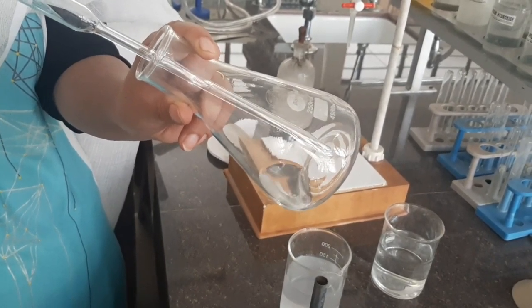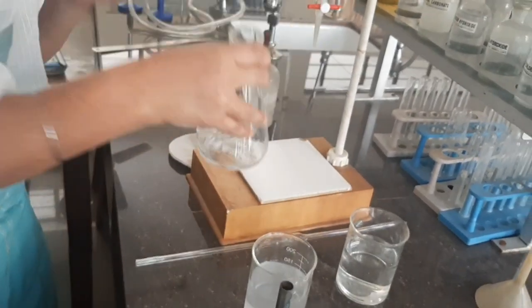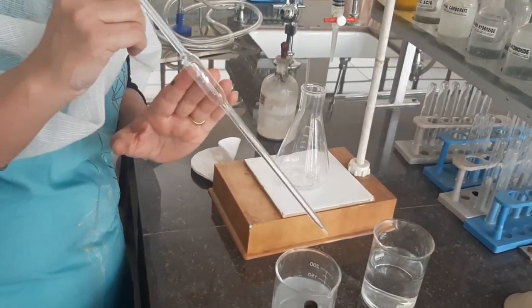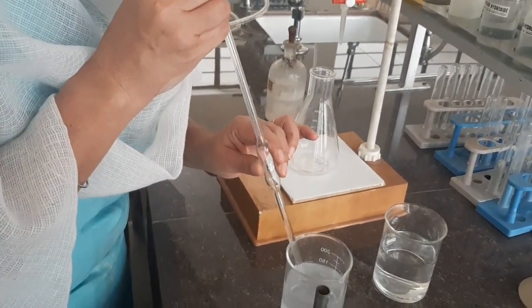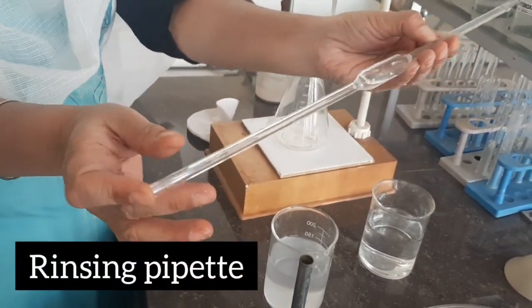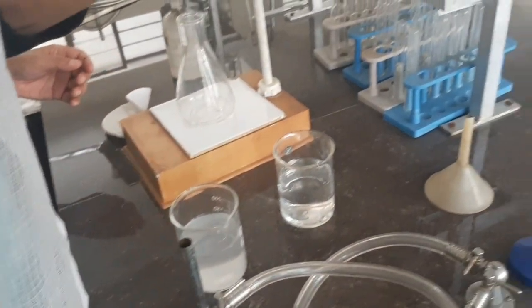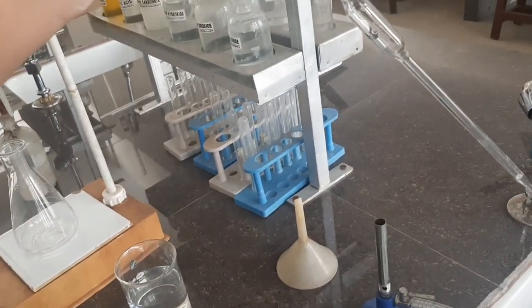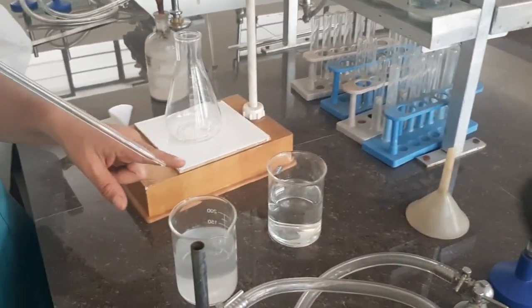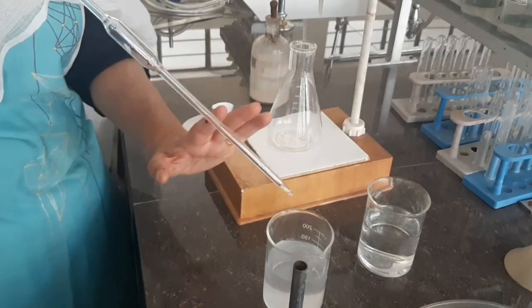When transferring into the titration flask, make sure you do not blow out the last drop. Just touch the tip once or twice at the bottom of the container. Now let us rinse the pipette — suck in a small amount of liquid, swirl it so it coats all the walls, then discard it into the sink. Do not discard this liquid back into the sodium hydroxide container.